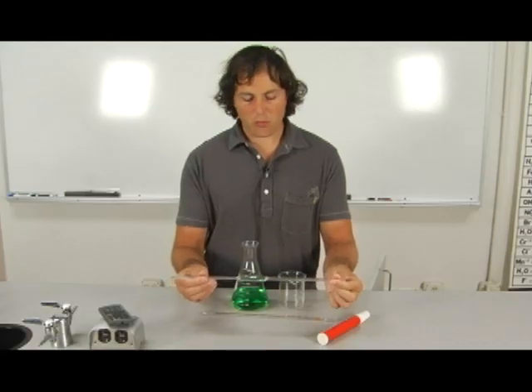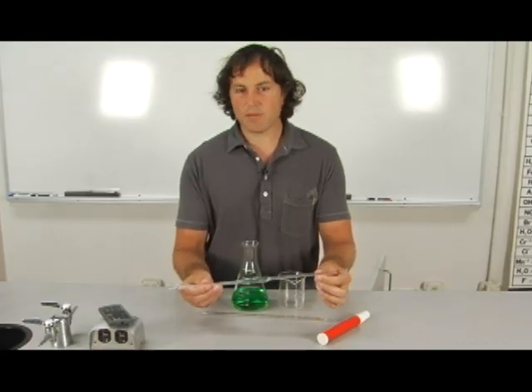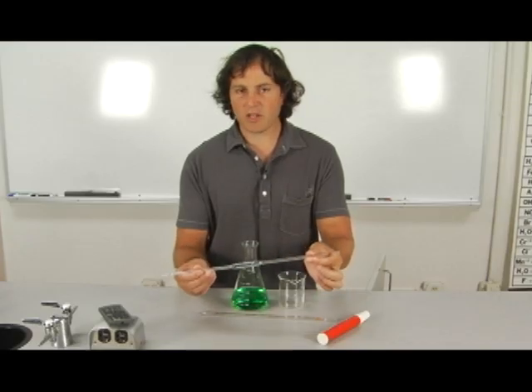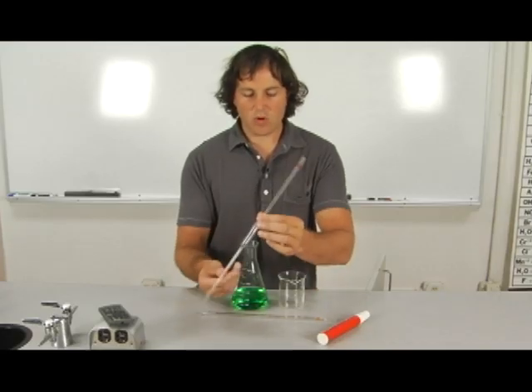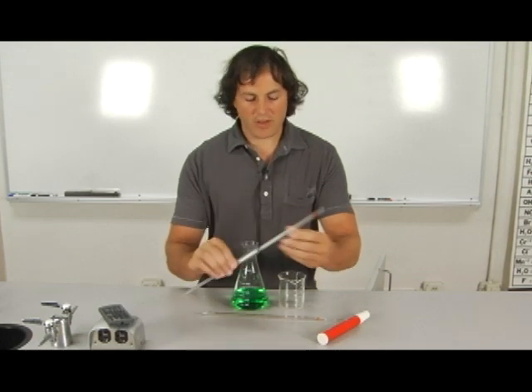A volumetric pipette, which is most accurate, but limited in its use. This will only read to 10 milliliters. It will tell you what its volume it can read to right here. There's one line on here that will read to that value and no other values.